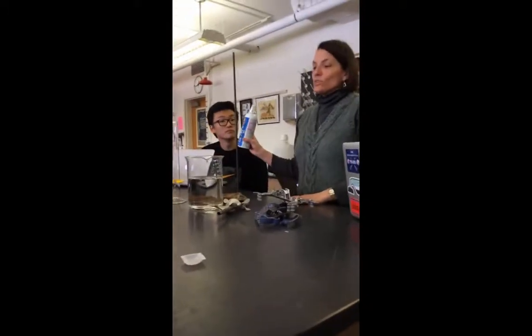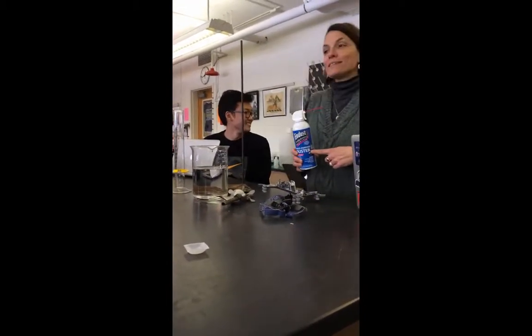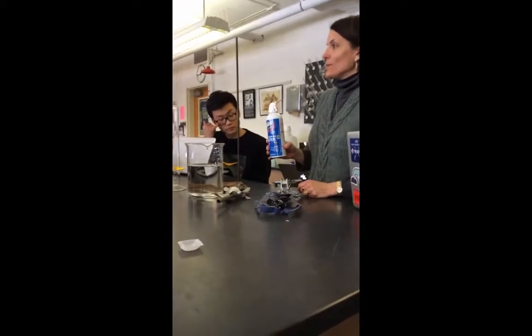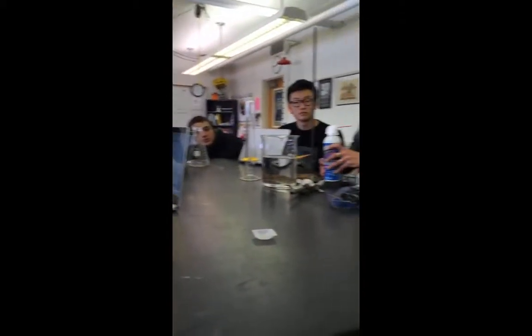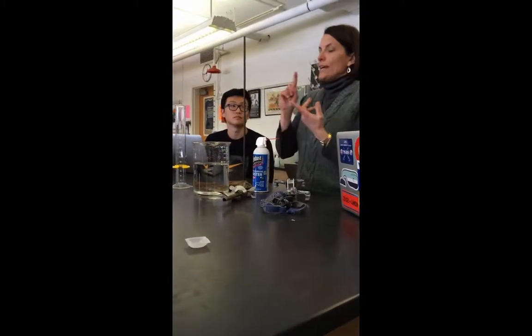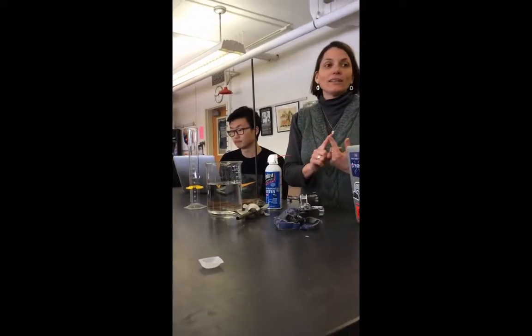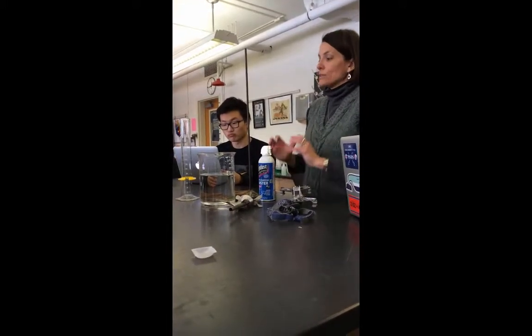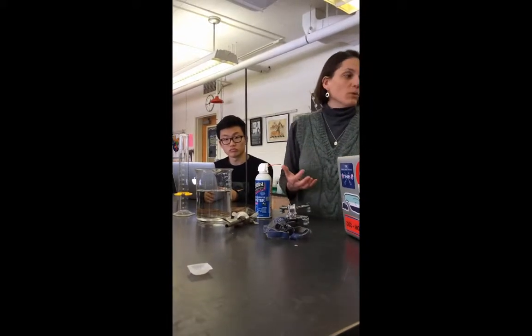Okay, so what we're going to do is use the ideal gas law to determine the molar mass of the aerosol compound in this dust blaster. We have to collect some data, because there are four variables: pressure, volume, temperature, and number of moles. We'll calculate the number of moles of gas and also figure out how many grams of gas we're releasing. By doing that, we can find the ratio of grams to moles, which is the molar mass.